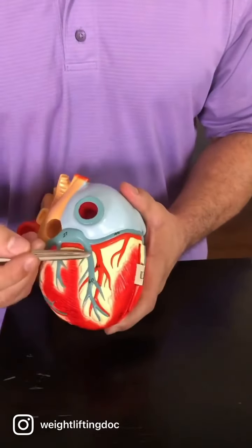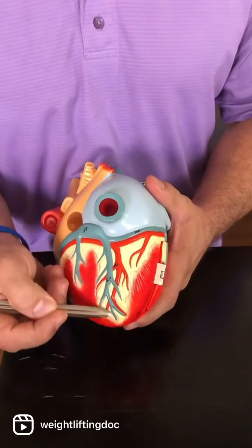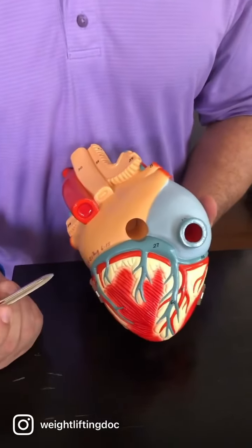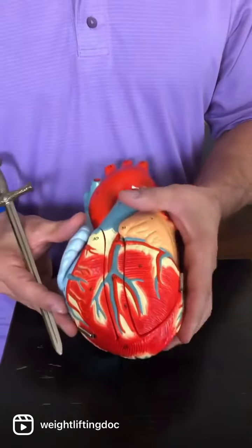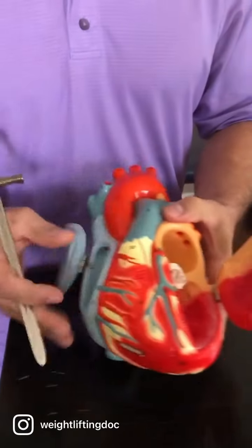Let's go to the back. Between the ventricles, running with the posterior interventricular artery, we have the middle cardiac vein. And I already showed the coronary sinus a couple times, so we're good. Those are all the ones that are on our list. Now we've got to do some structures inside the heart and go from there. So let's open this guy up.